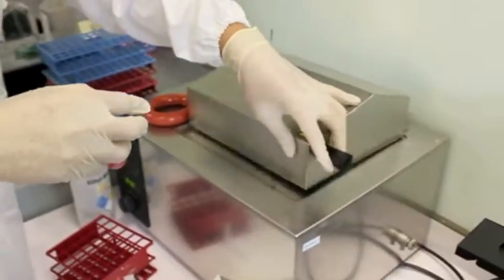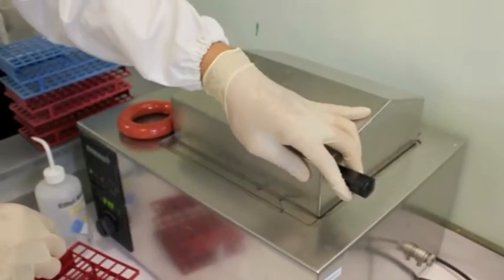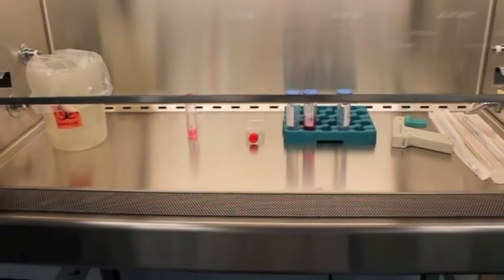It is important to always warm up your media before adding them to the cells. So this is what your hood should look like. And not like this.